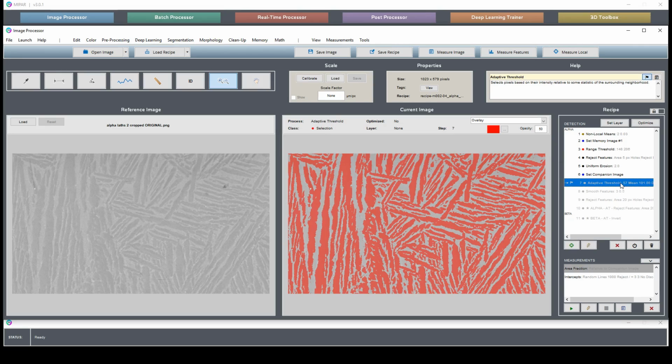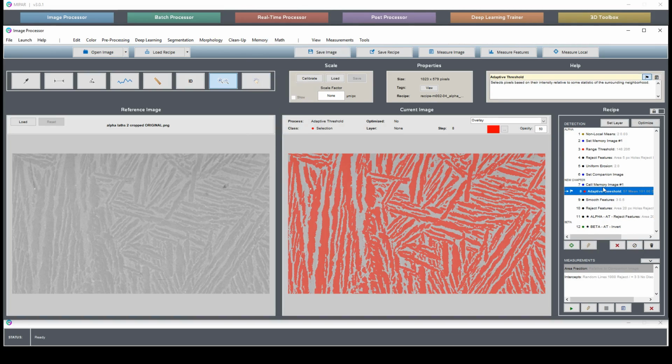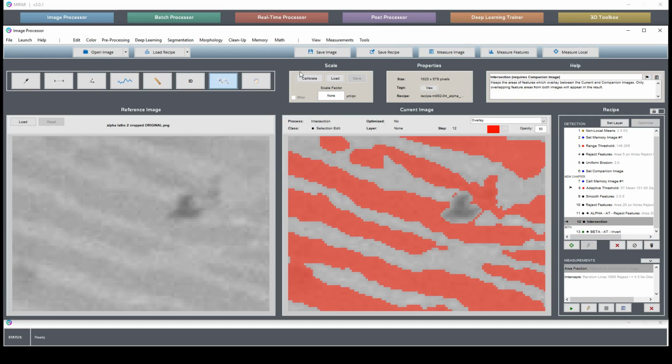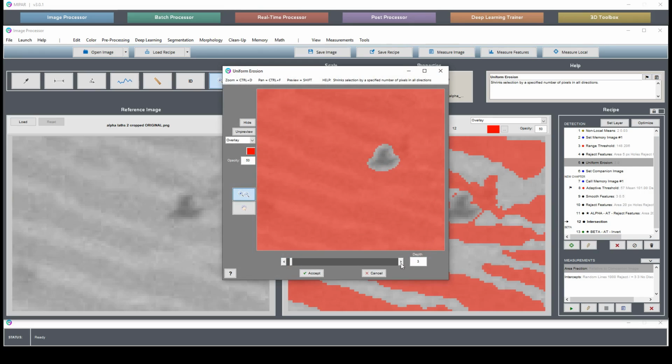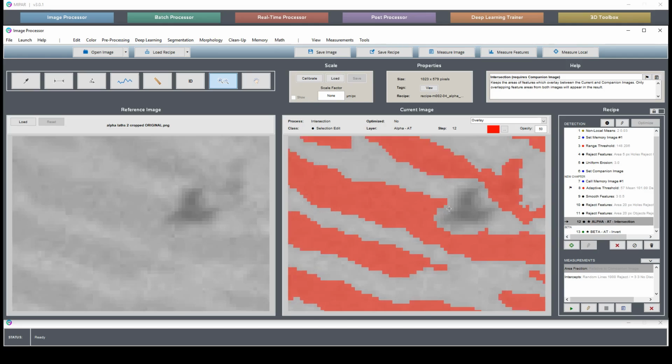Okay. Now, let's call back our noise reduced image for the actual adaptive threshold processing. And here we have our alpha, which has this piece found, and we'll just intersect. Just like that. Now we can see we didn't quite erode enough. So let's make that 3. Okay, now the entire piece is gone. And move our layer. And that's our corrected alpha selection.